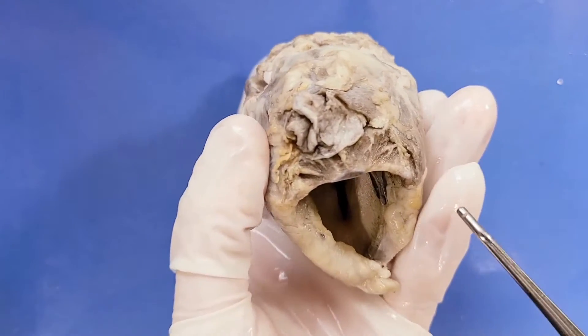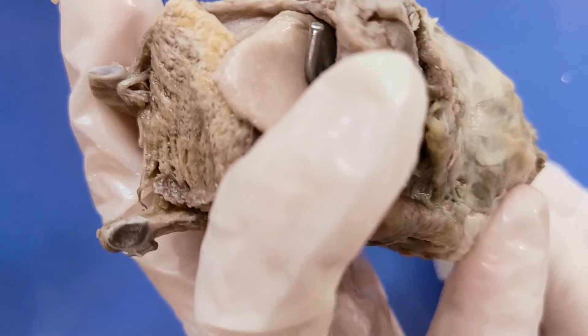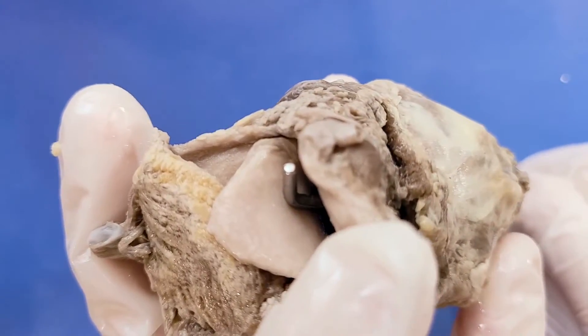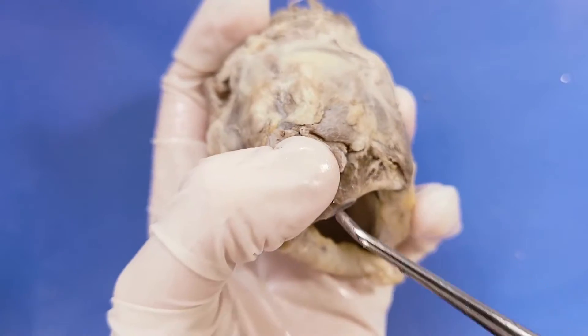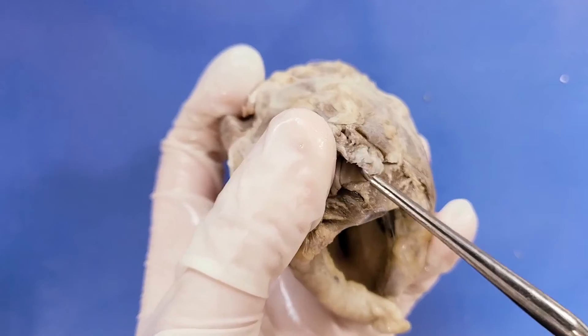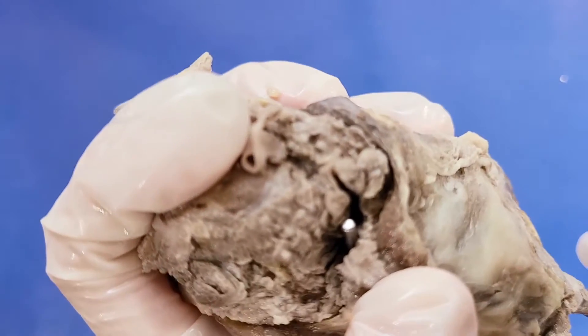Here on the inferior side you can see the trachea again, and if I put my probe in, you'll see it comes out to the trachea on the other end as well. Next to the trachea is the esophagus right here, and if I put my probe in through here, you can see that it comes out through the entrance to the esophagus that we saw earlier.